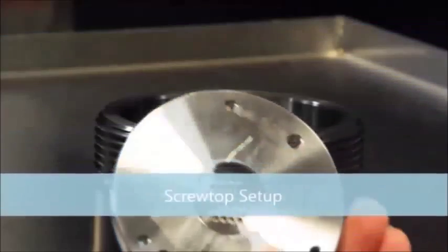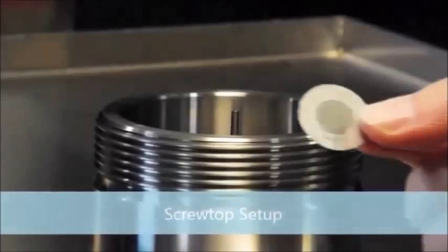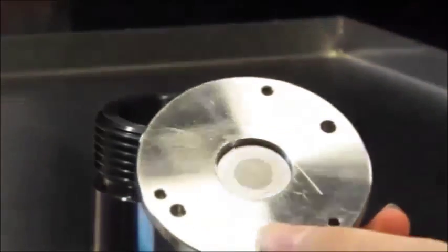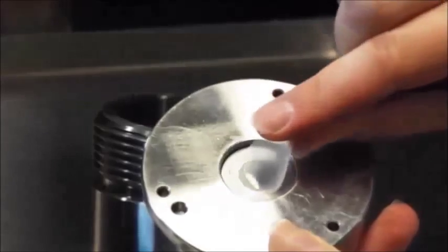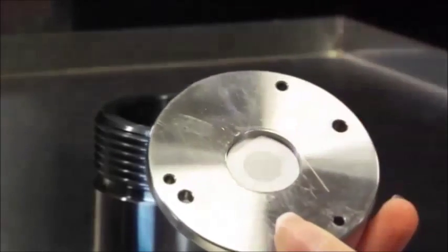This is the base of the screw top chamber, and here's an adapter plate that goes inside. This is a millipore support screen that keeps the sample from being damaged in high pressure testing. This is the sample, a membrane. It's a very thin sheet which could be damaged if it didn't have a support screen.